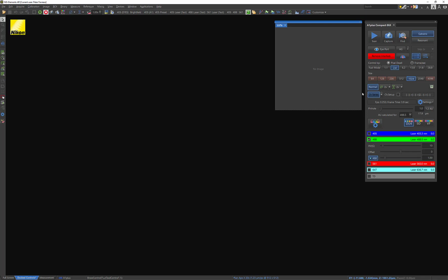Now, which settings are going to give me the most bang for my buck, so to speak, in optimizing and controlling the number of detectable photons? And that's important because, of course, the number of detectable photons is going to directly correlate to better image quality. The more signal I acquire, the better looking my image is going to be.